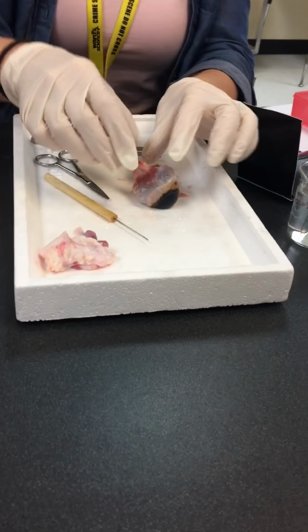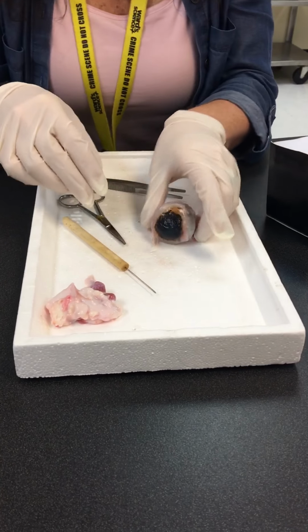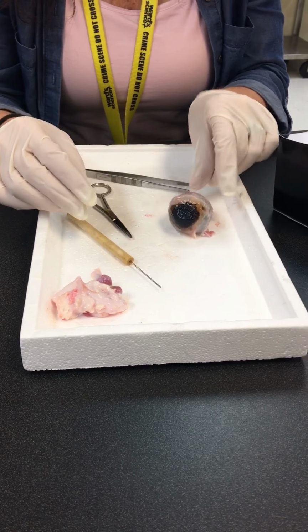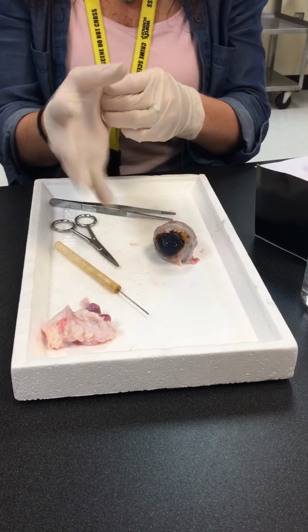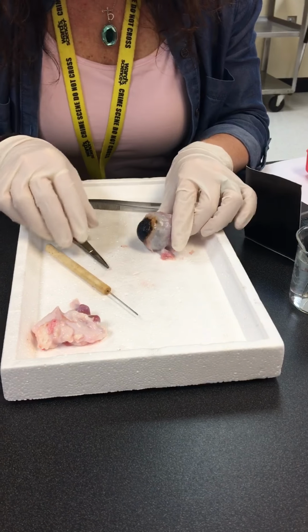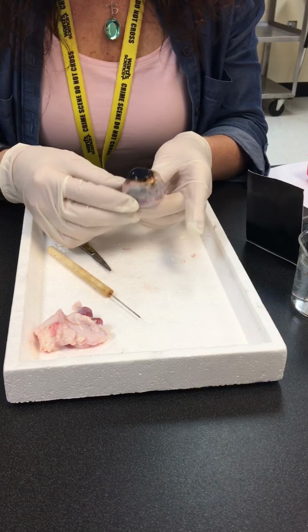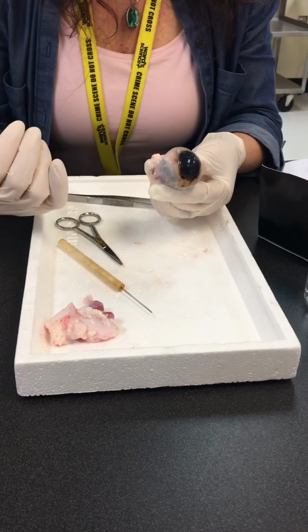So now you can definitely see this optic nerve that's sticking out here, okay? So, you notice it's not too bloody, okay? There's not a whole lot of blood involved in here. We really don't get into much of it either. There's not gonna be much blood in your eye. There is, but that blood's probably already drained out.